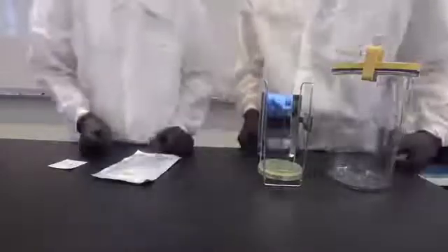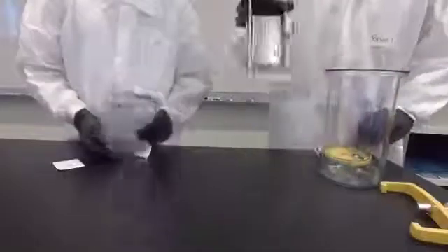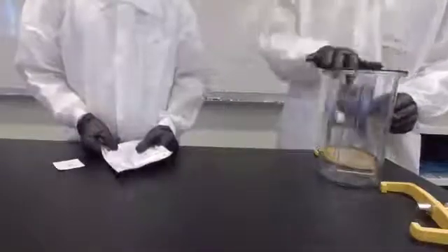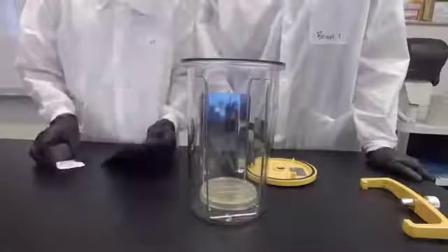If you haven't already done so, now is a good time to unscrew and remove the lid off the jar and then you will place the loading tray inside of the jar. This is also a good point to double check and make sure that all of the plates on the loading tray are loaded upside down.